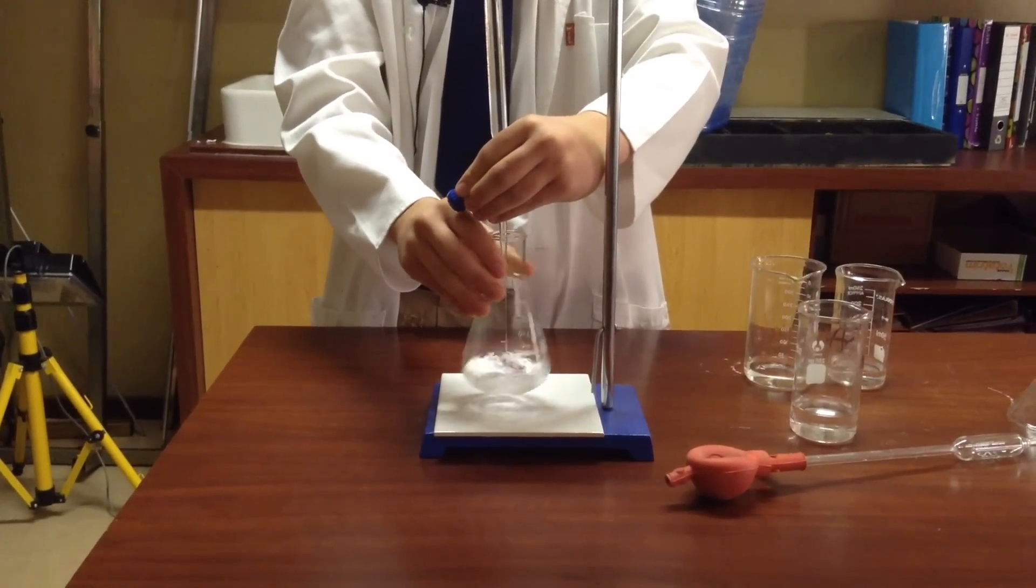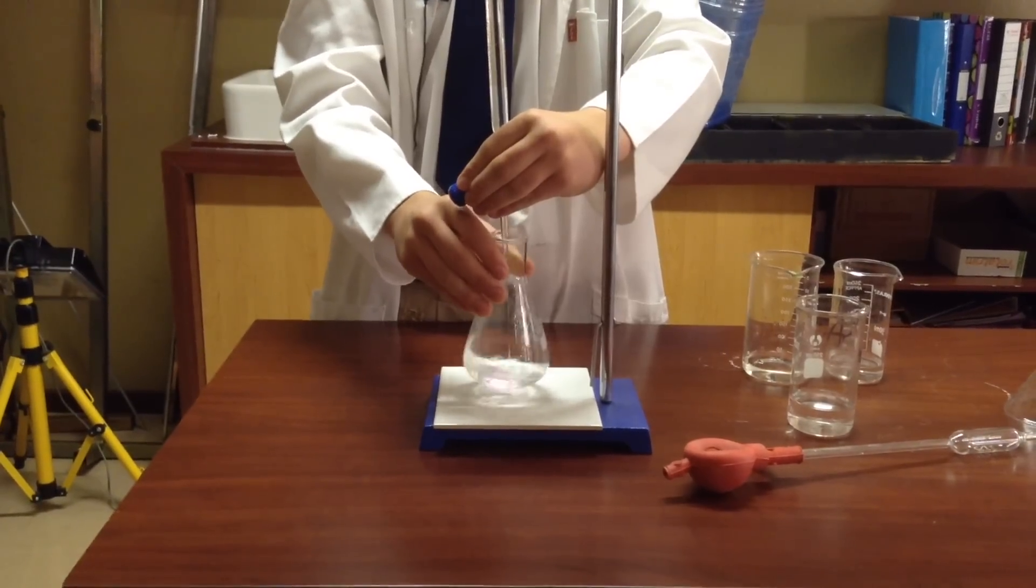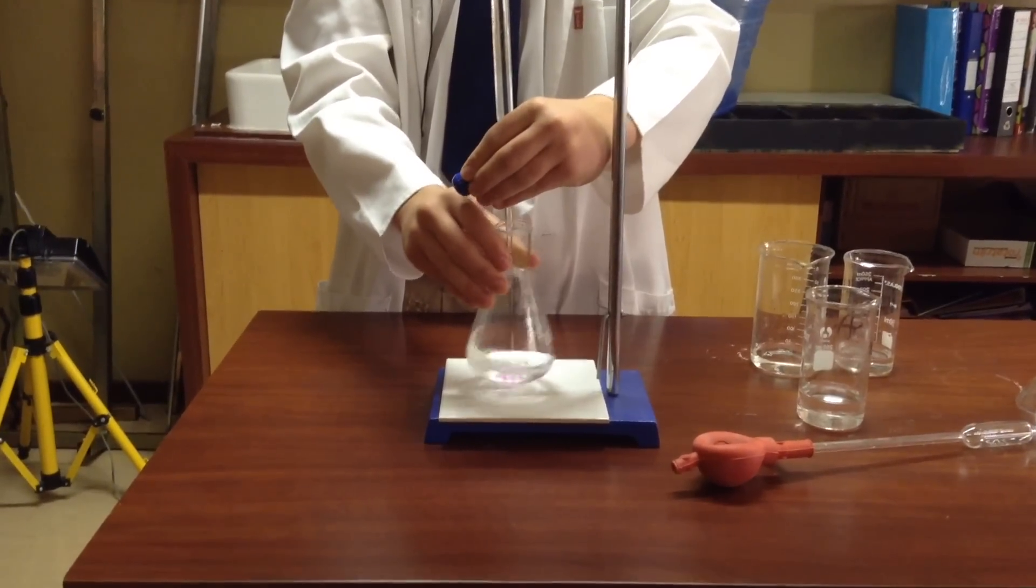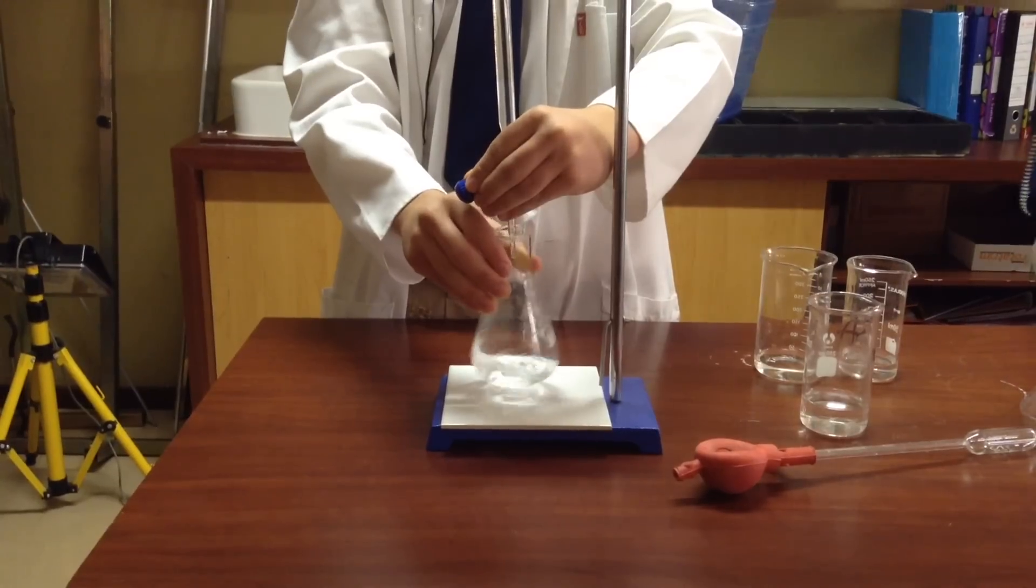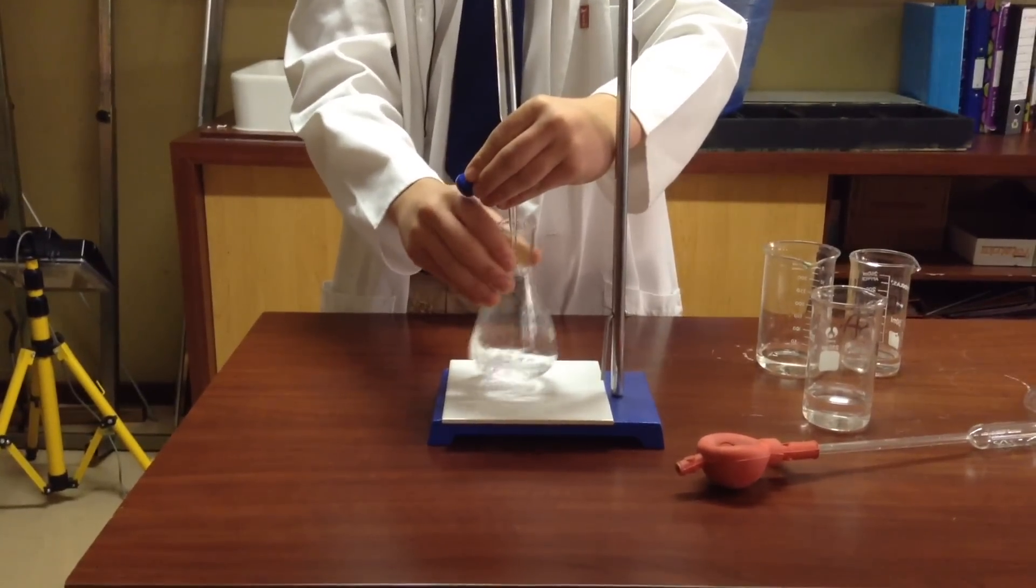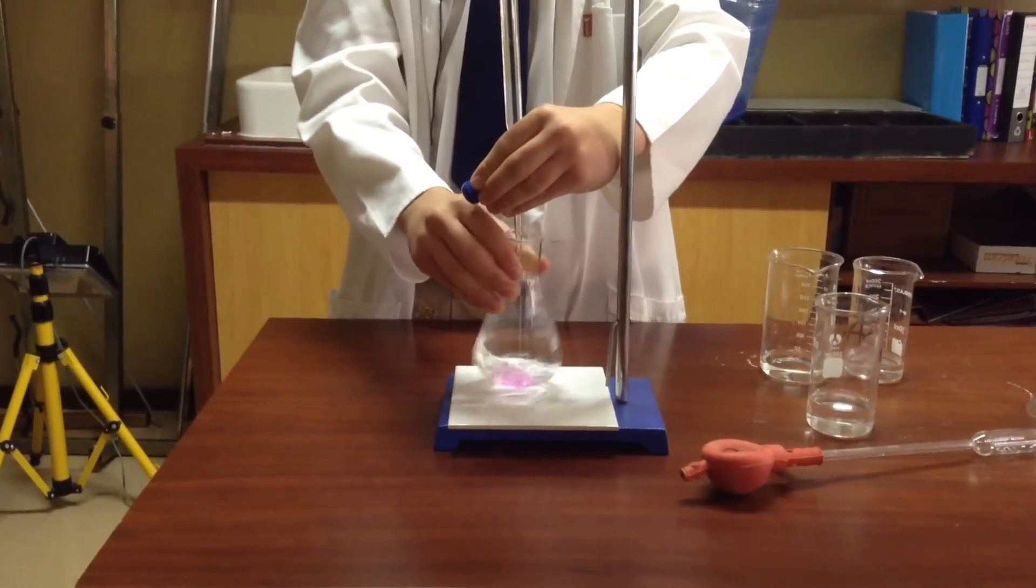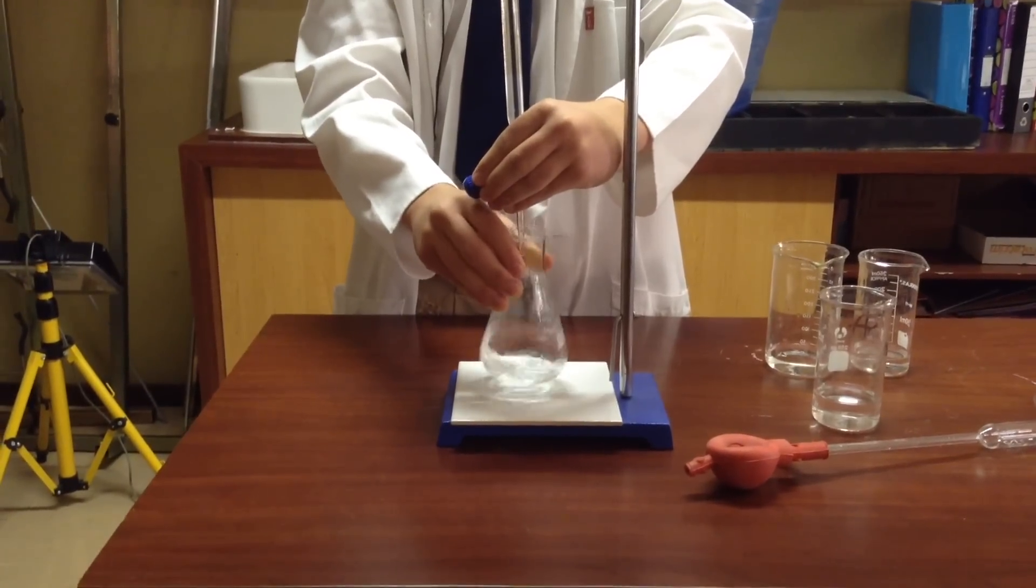We just carry on doing that. And I already know there's at least nine in here, so I open it quite a bit. And you basically want to carry on until you get a rosy pink. So if we carry on, you'll see that the pink stays longer the further we go.